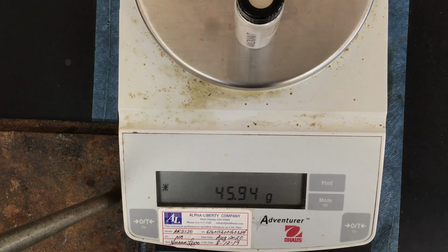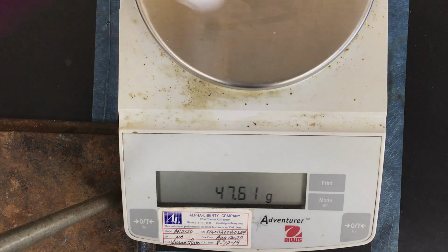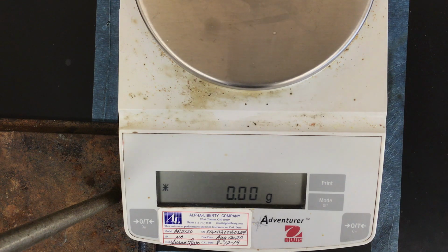And then in the post-lab questions, I told you how many moles of the sample are in this vial. I need you to use that information to figure out the molar mass of the sample. So you might need to play around with that a little bit. So again, feel free to rewind, pause, go back and look at some of those parts again, and email me or touch base with me with any questions that you have.